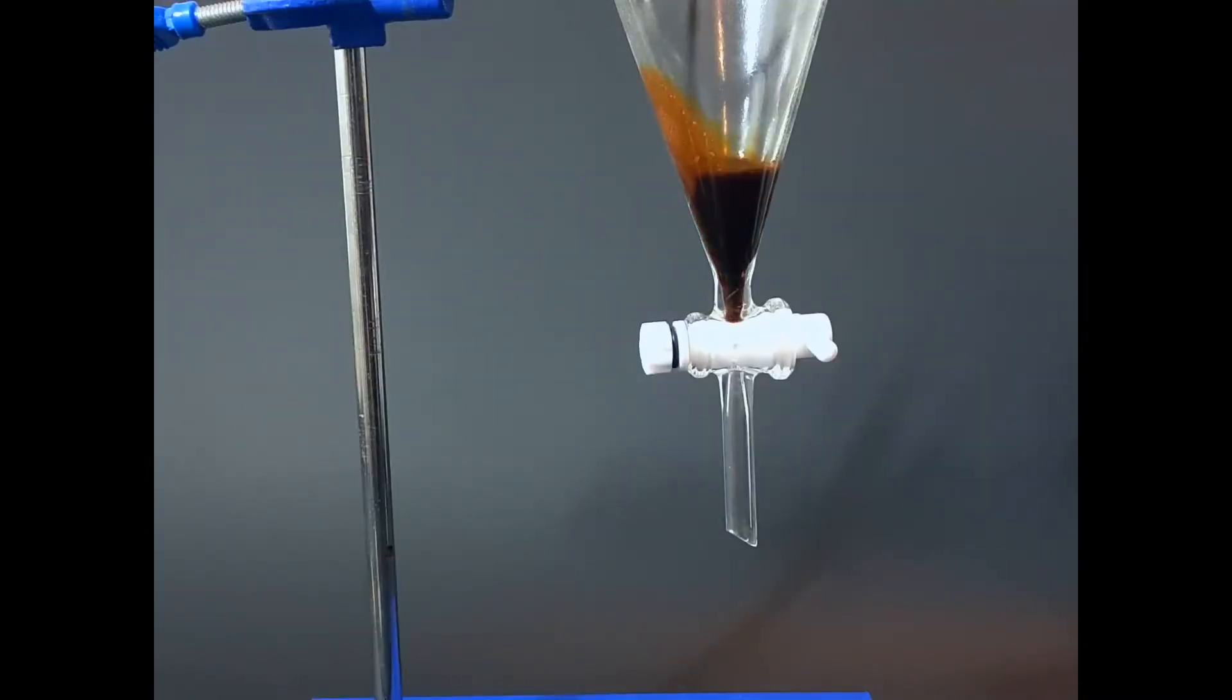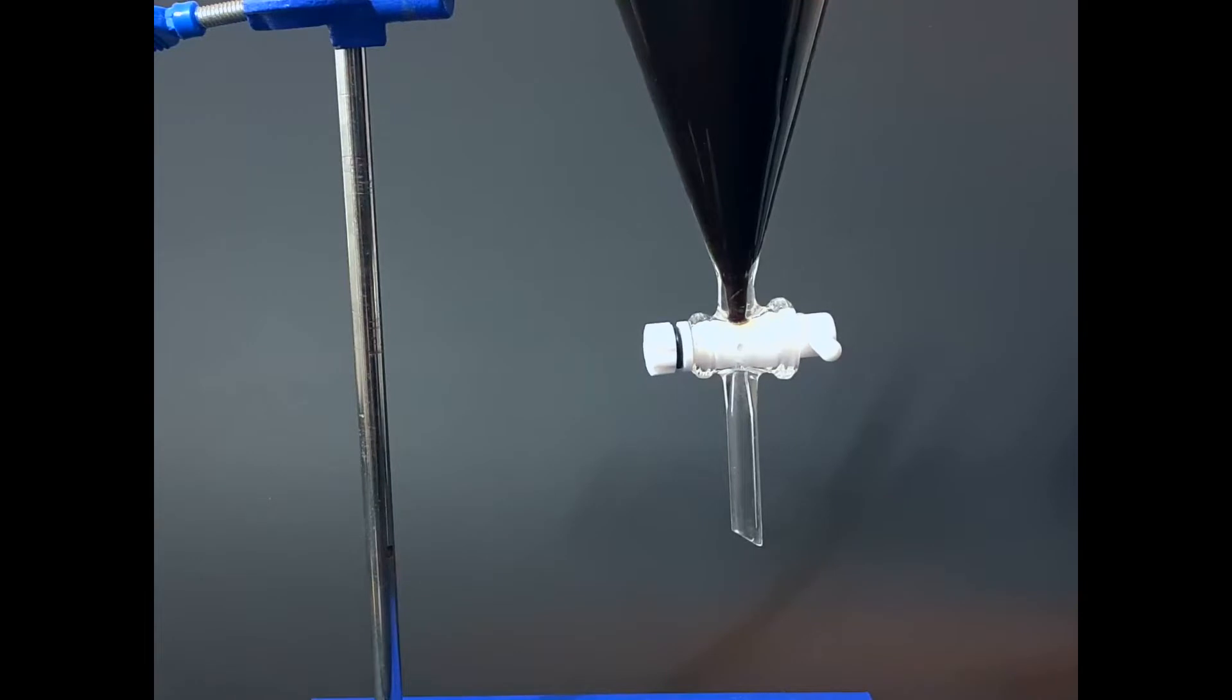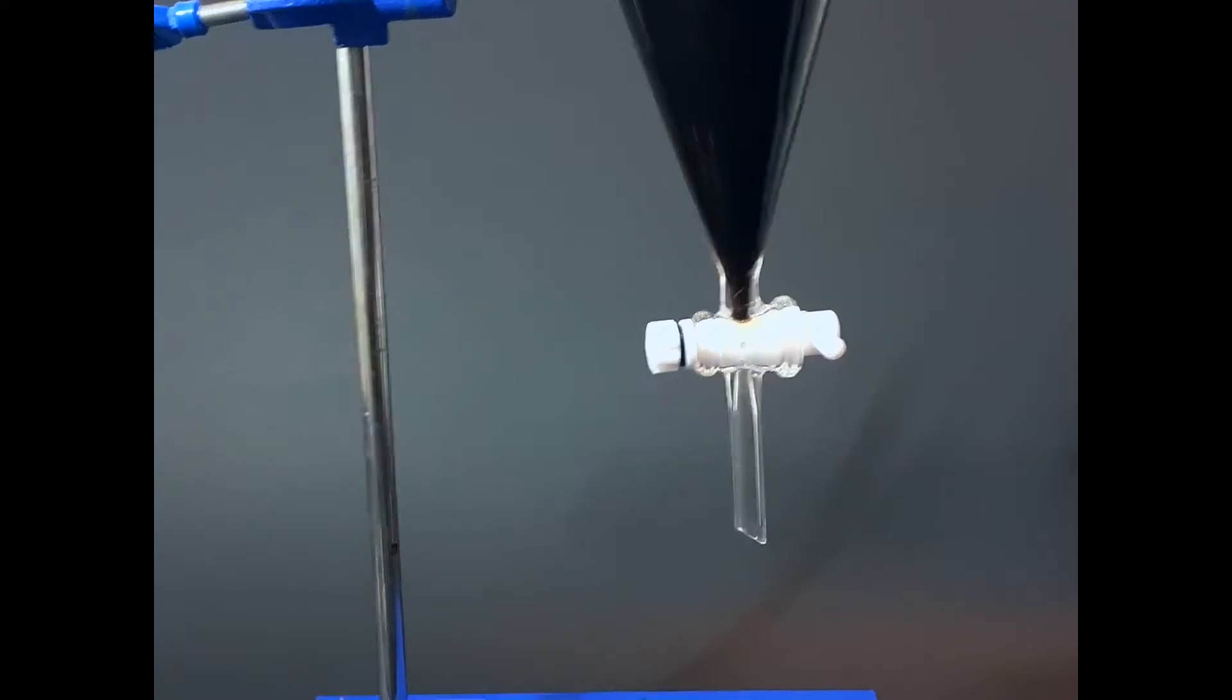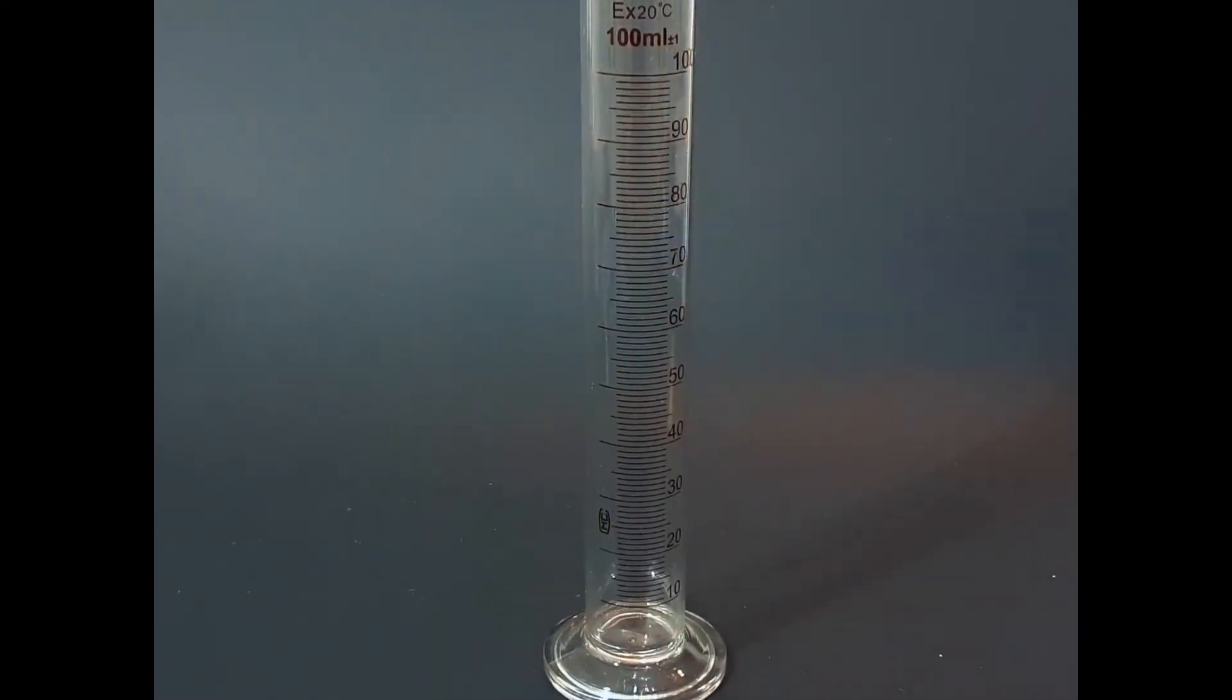Here we have a separatory funnel, and I'm going to add the coffee. I'm just going to let it sit here for everything to dissolve nicely, and then I'm going to grab the bottle of dichloromethane.